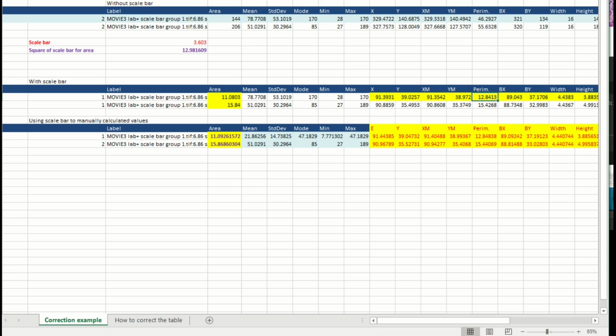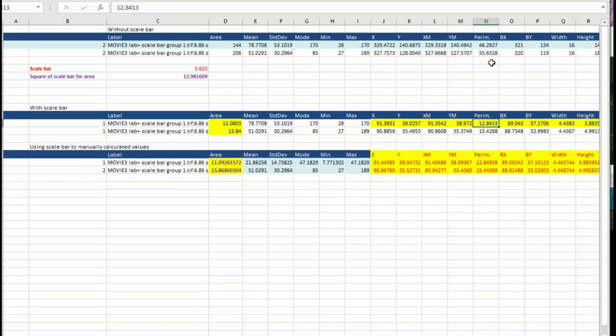Like the perimeter, you just have to replace it, make a simple division. For example, without the scale bar it was 46. With the scale bar it is 12. What is the difference? It's very easy. You just have to divide 46 by the scale bar, which is 3.6, and you will get this 12 value. And Excel allows you to do that very easily.